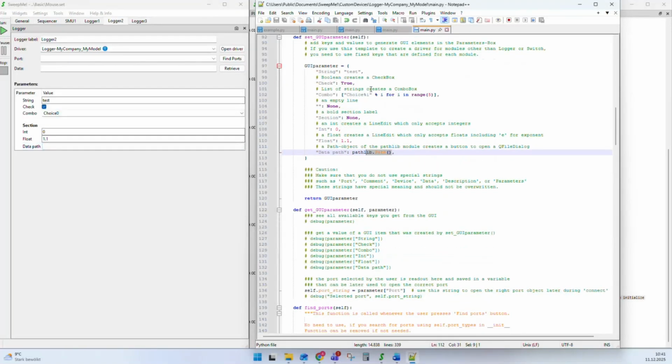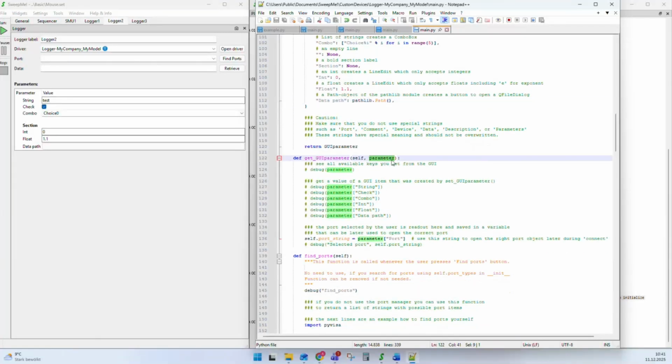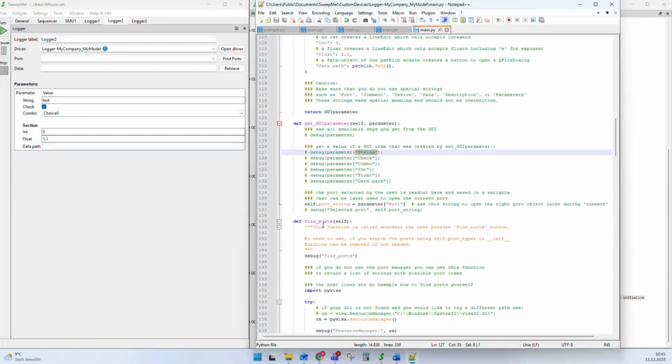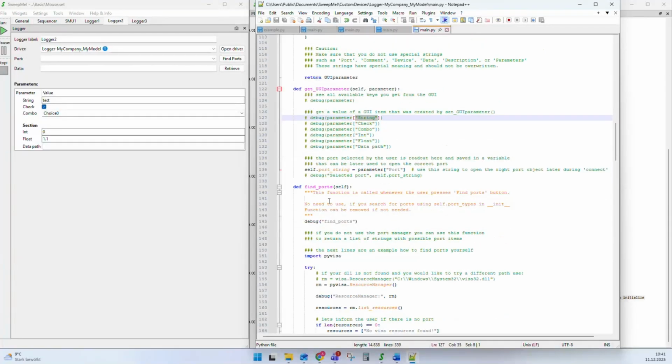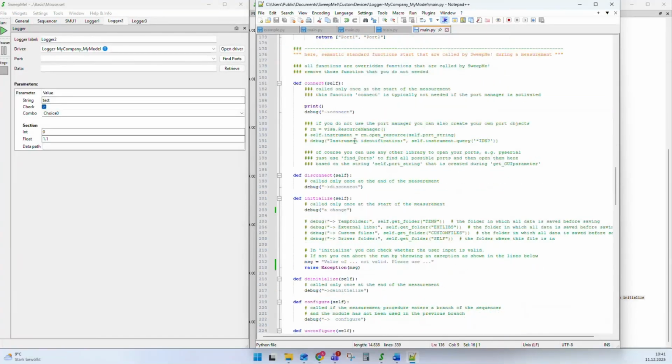These GUI parameters are then also transferred back to the driver in the function getGUIParameter. This means the function gets a dictionary from SweepMe. In this dictionary, SweepMe puts all the keys that we have used previously and adds the selection of the user as the value. Now you are free to get the value and save it as a variable, and then you can process it in your later functions, in your semantic functions like initialize and configure. For example, here one variable saves self.portString, and we could later on use self.portString in connect to send a command to an instrument.